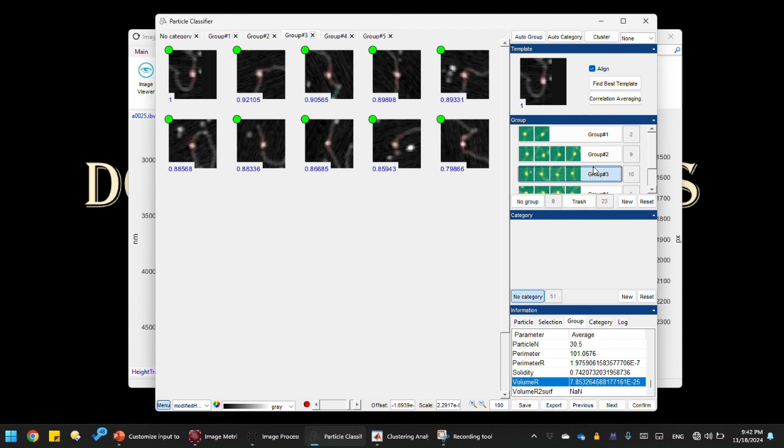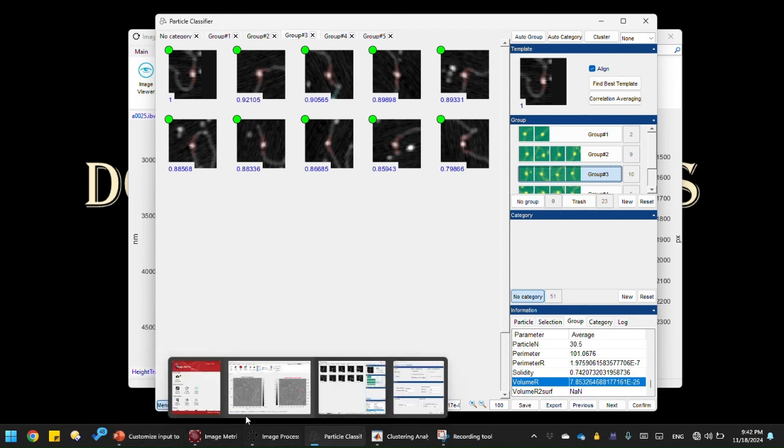If the protein sits tall, it dilates more, and that creates a bigger volume compared to when the protein sits low, even though they are supposed to be the same sized protein. They probably are, but the data output by the AFM would be different because of the tip dilation effect. That depends on how it sits on the surface. So this method, by using raw data as input, suits best for analyzing the protein DNA complex according to its size.